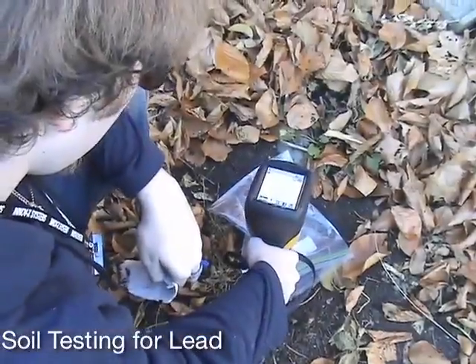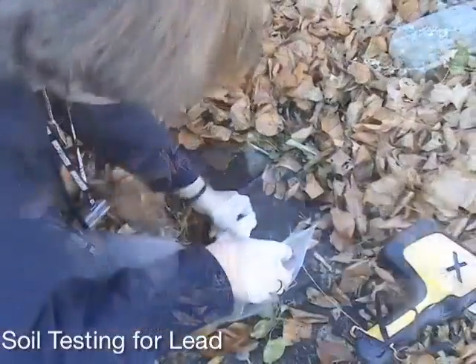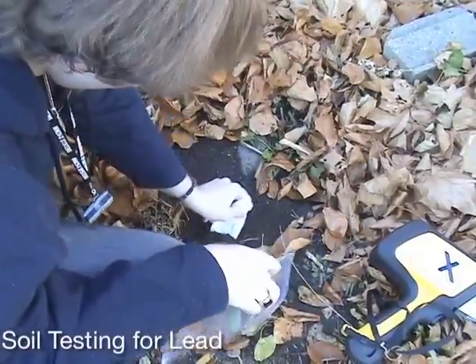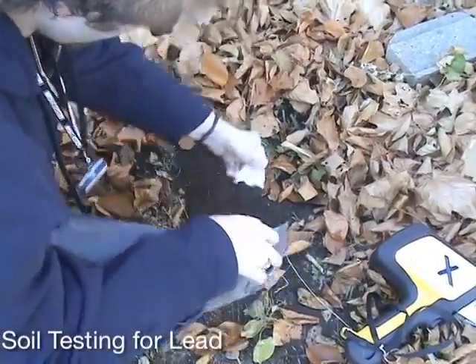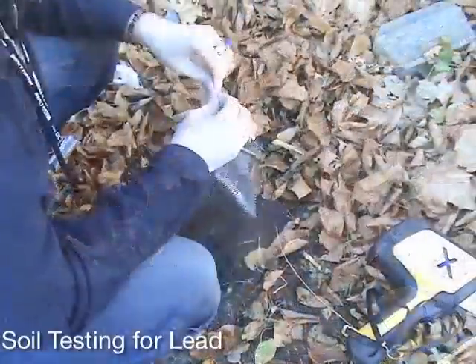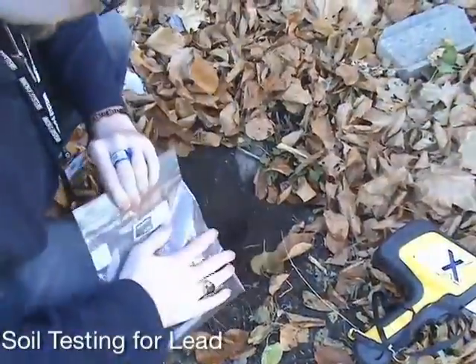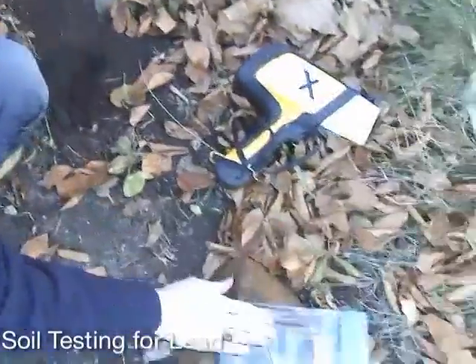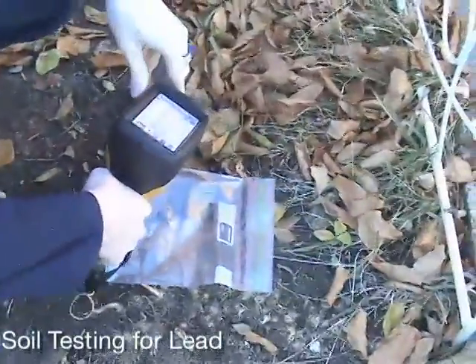To test a sample that is more representative of the soil than just the surface, it's recommended to dig up some of the soil, place it inside a baggie, and mix it up a bit. This is a more homogeneous sample and may improve accuracy and precision.